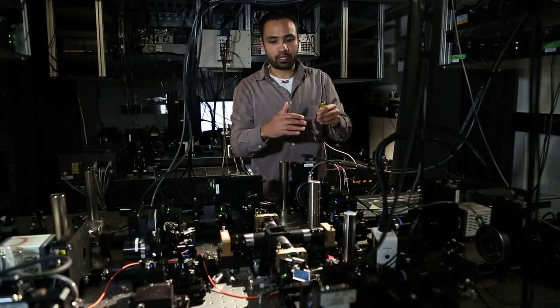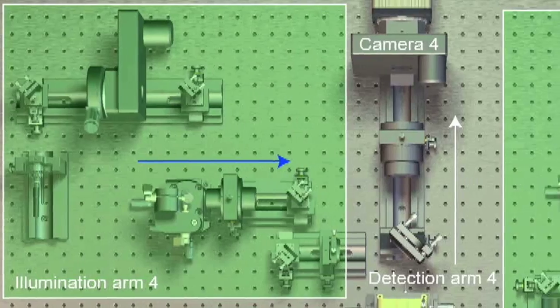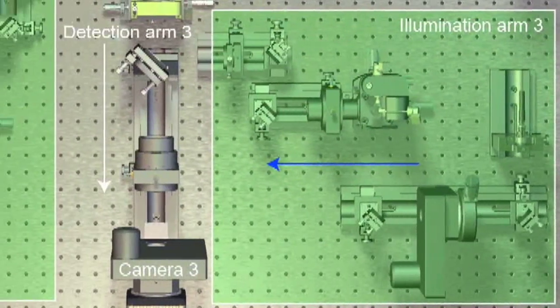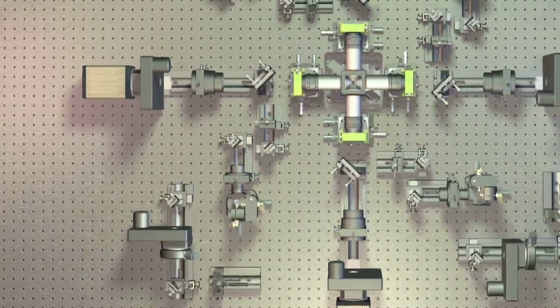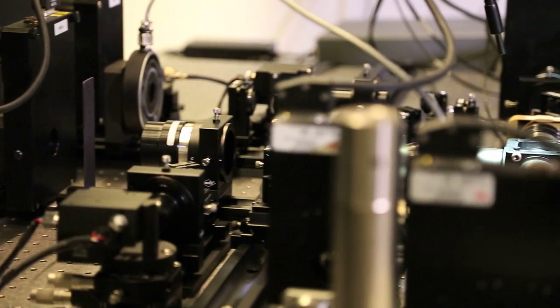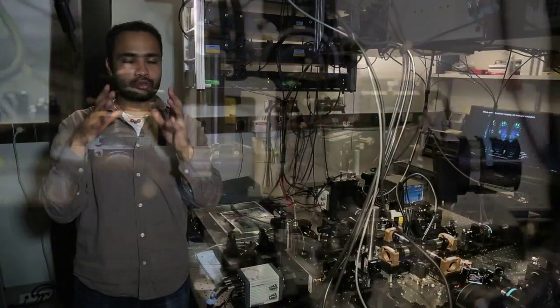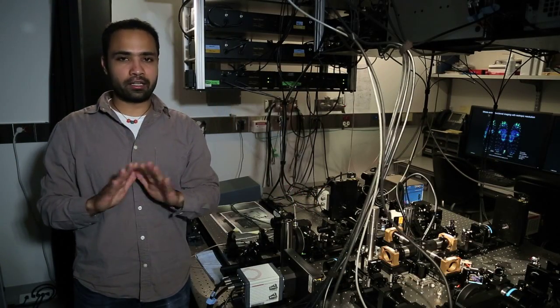This basic setup is repeated four times in four different arms, and that basically allows us to generate light sheets from four different angles, and the cameras at four different angles allow us to collect the fluorescence from four different angles, giving us isotropic resolution in our images. And the fact that we don't have to wait and take turns, and we can simultaneously acquire different volumes, gives us the speed that we need for these high-speed experiments. So in this way, you have a true 3D representation, and you can access your data in any which angle, and you don't have any loss of information.